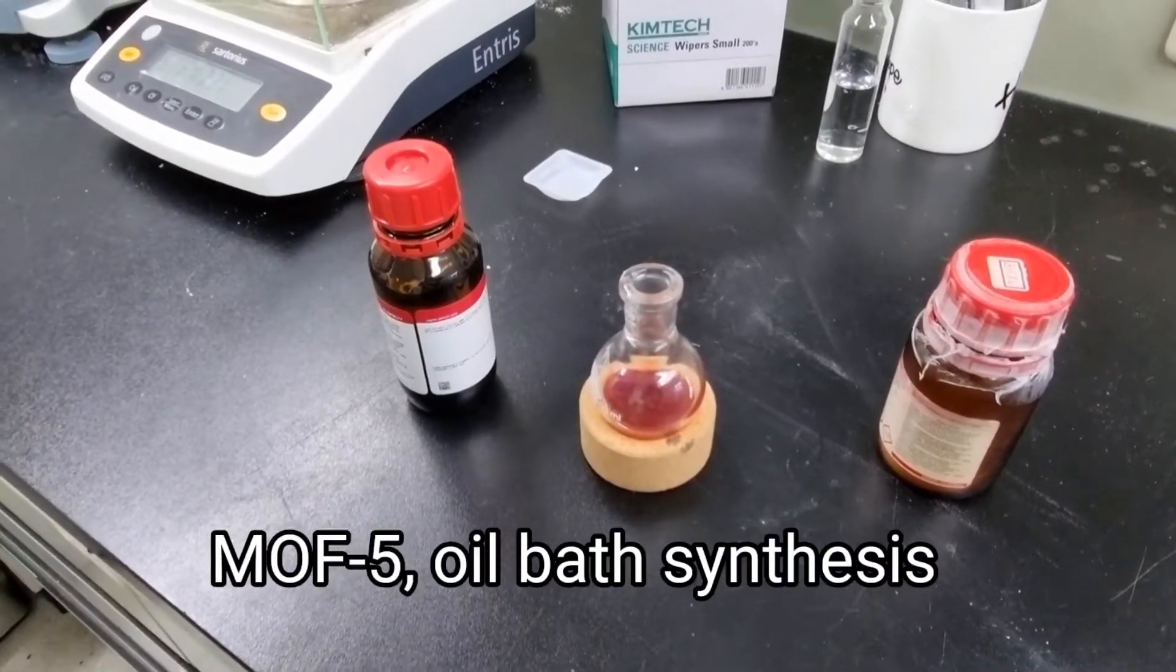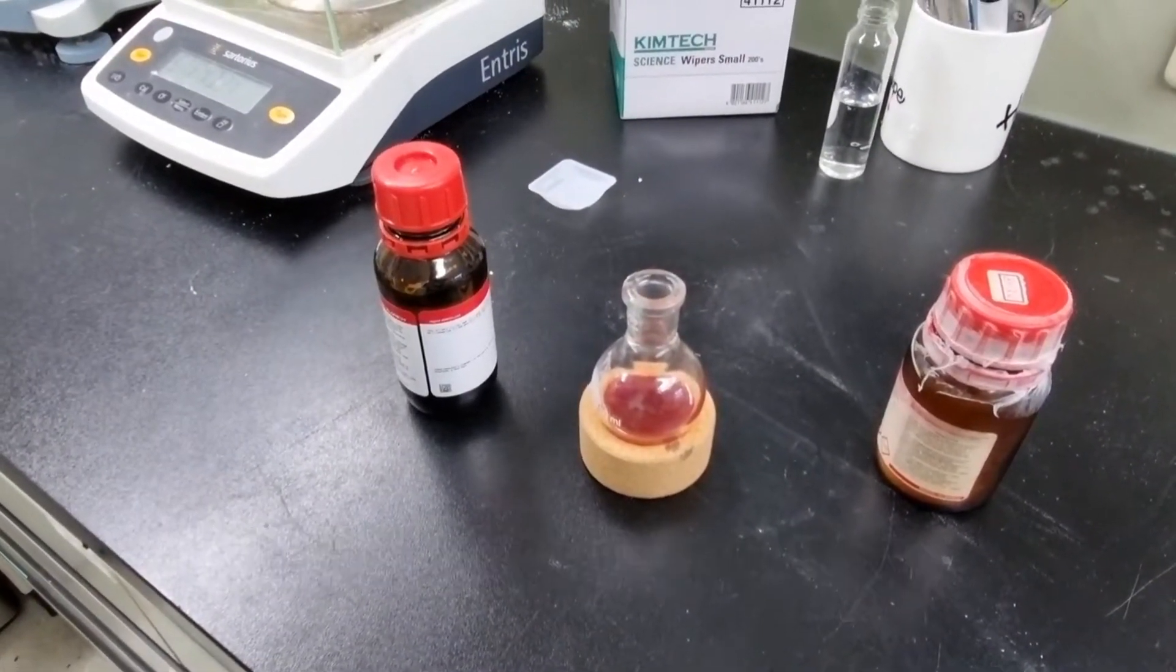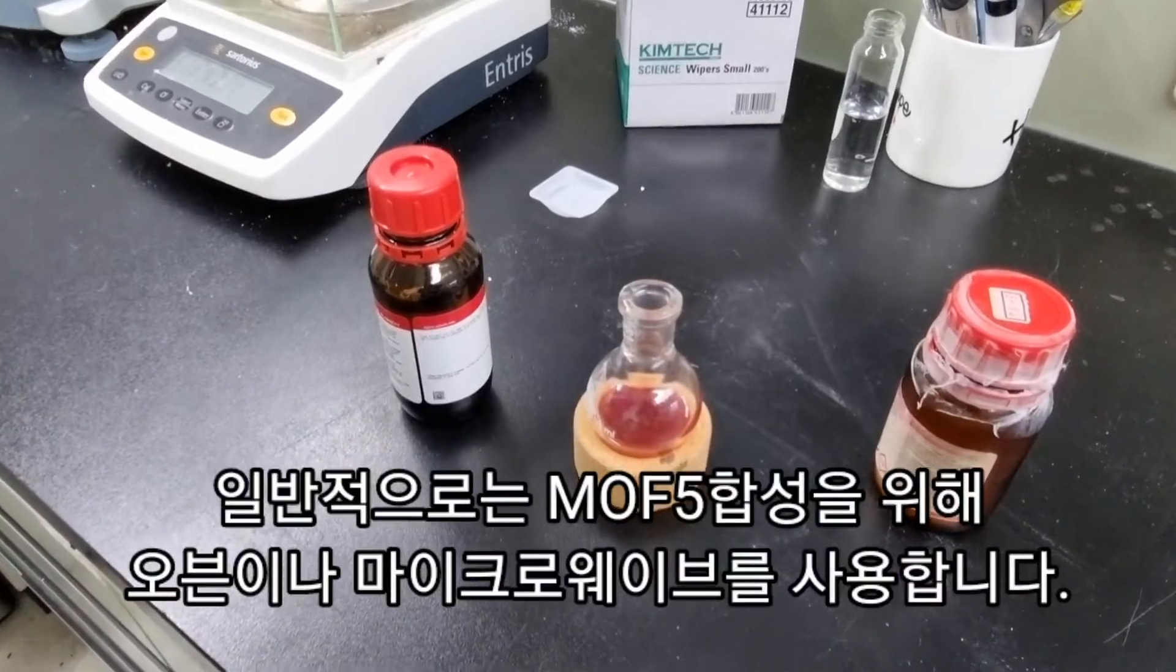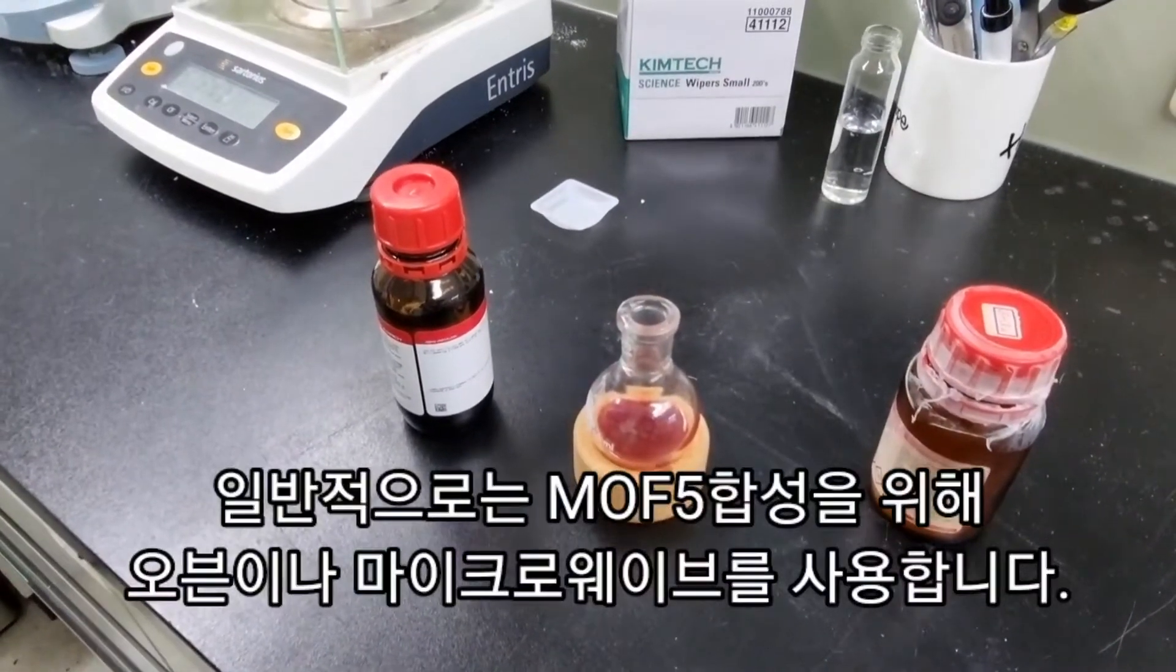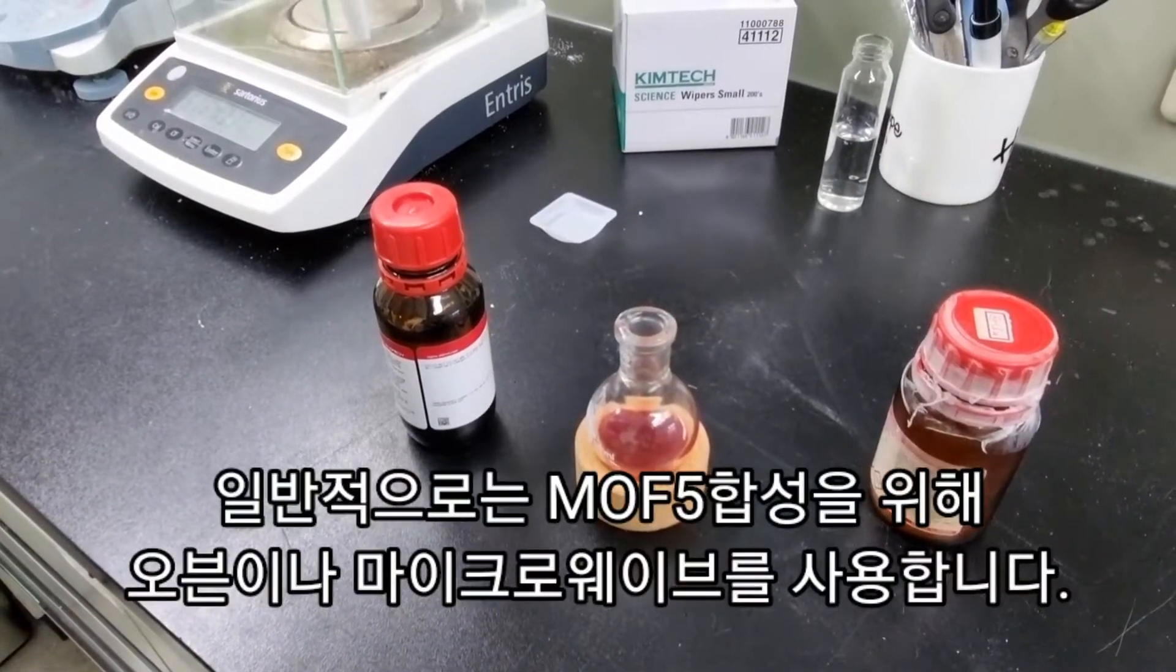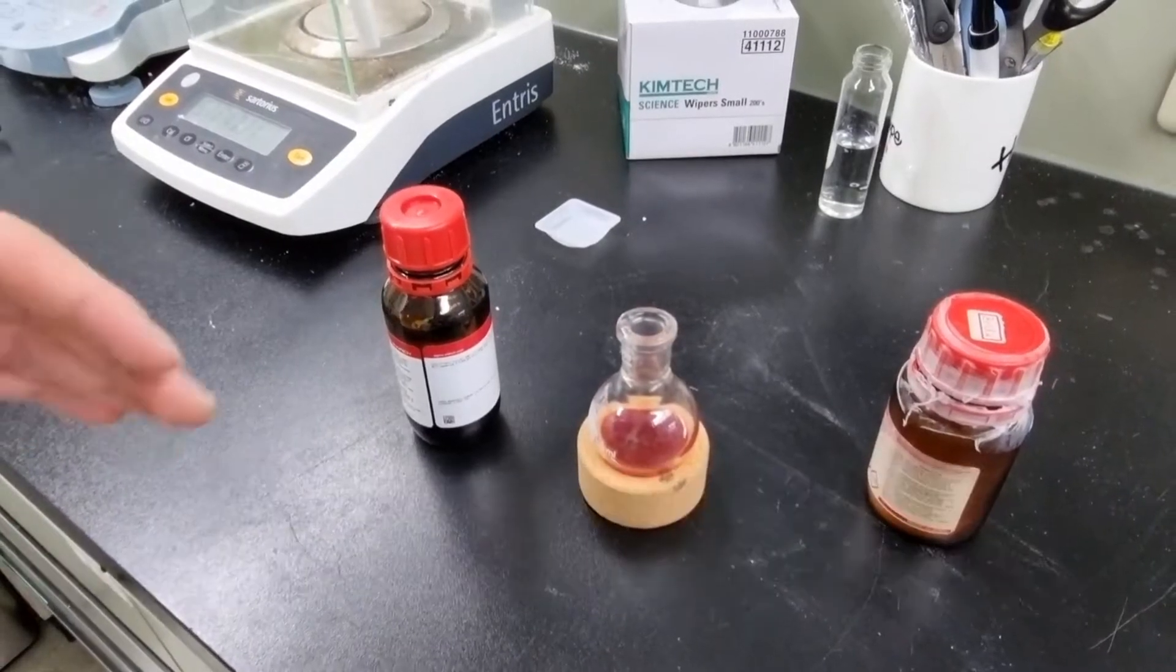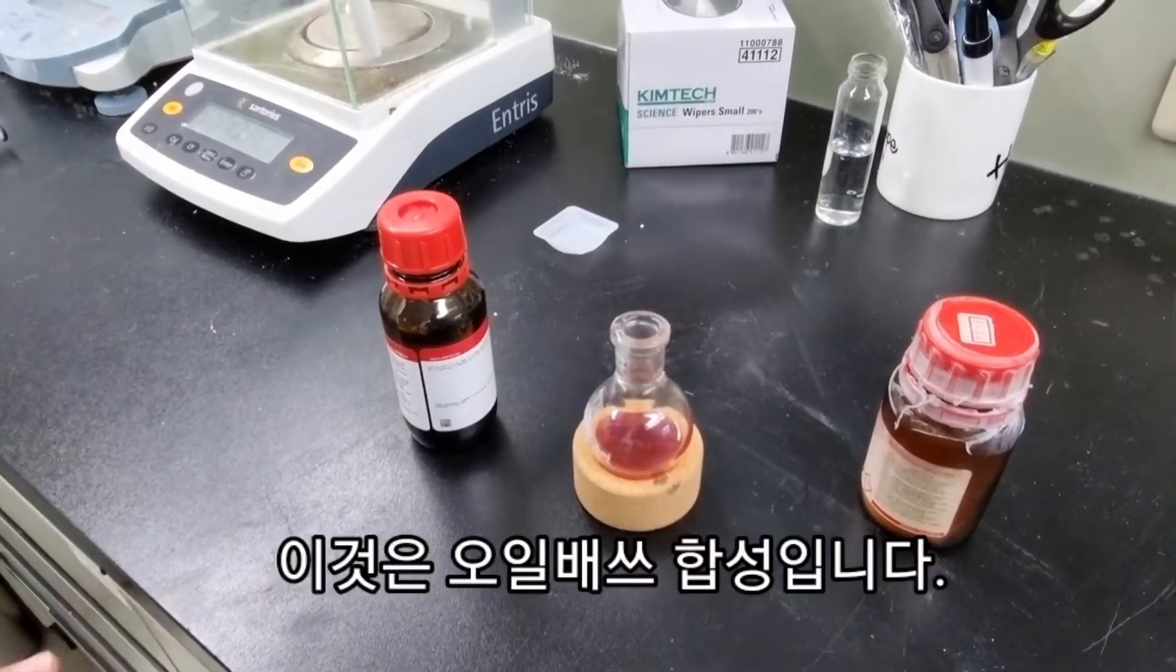So this is a different kind of MOF synthesis. We occasionally use, we usually use the microwave or the oven method, but this is called the oil bath synthesis.